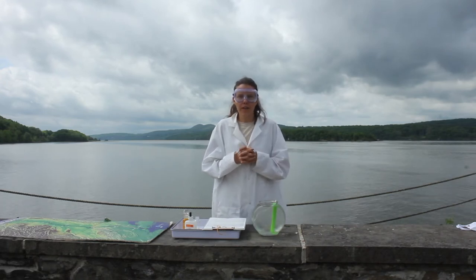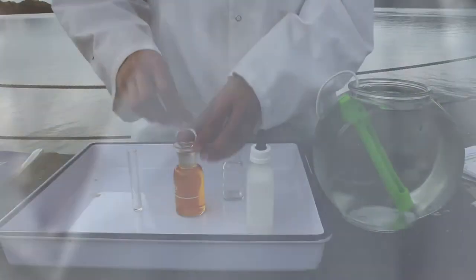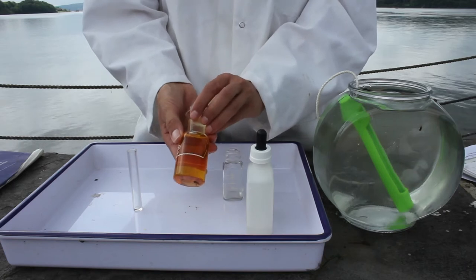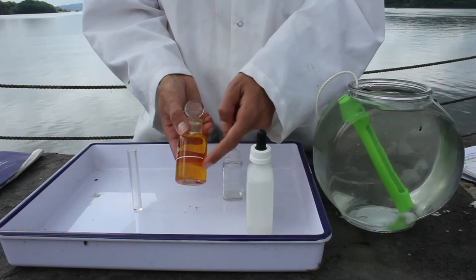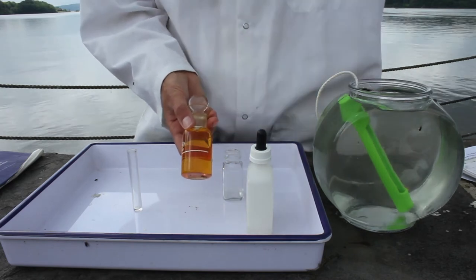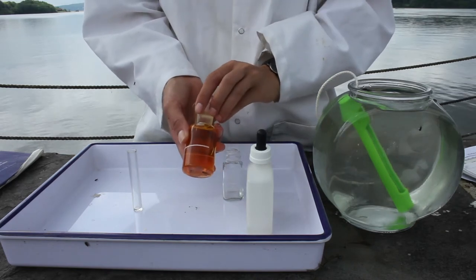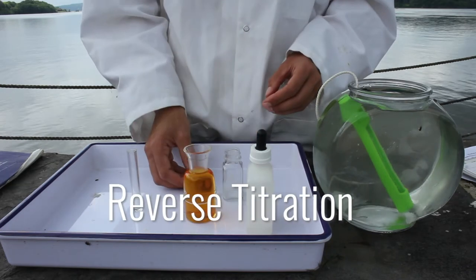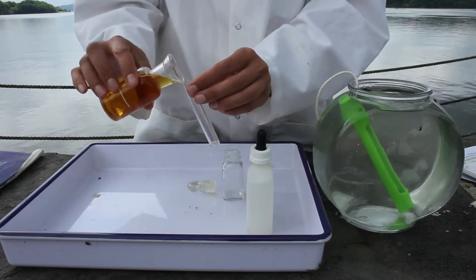Now, we're going to figure out how much oxygen is in the water today. Come on over! So what we're going to do is start with this sample where I've taken Hudson River water and dyed it so that we can actually see the oxygen in the water. Usually, oxygen is hard to visualize because it's clear. So we're using this method of reverse titration in order to be able to see how much oxygen is dissolved in this water.